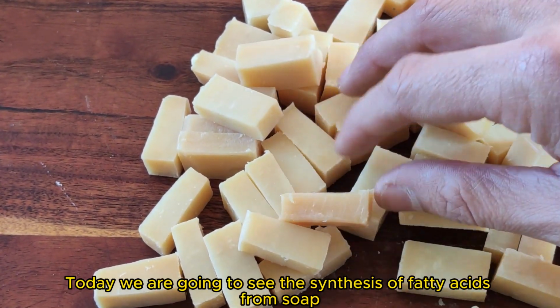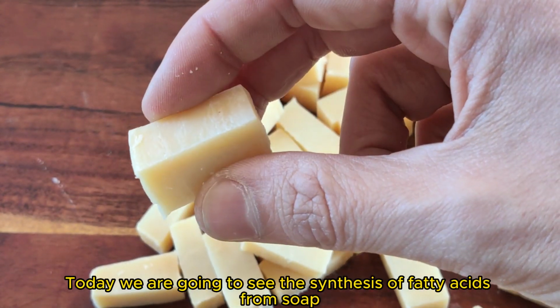Hello people. Today we are going to see the synthesis of fatty acids from soap.